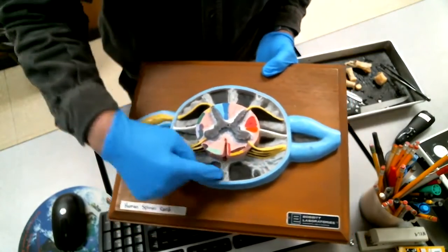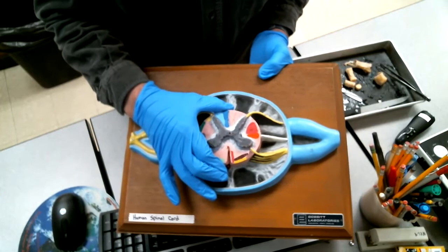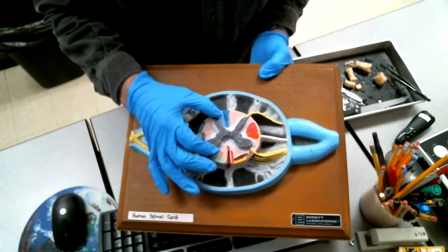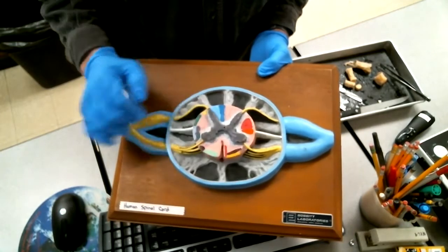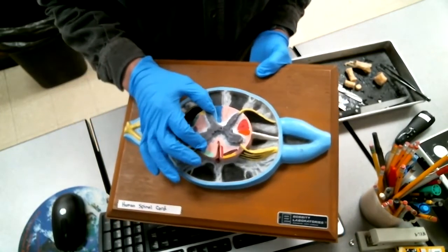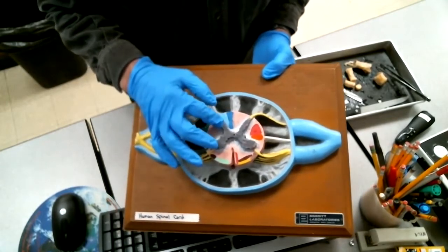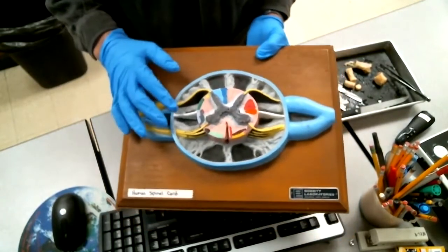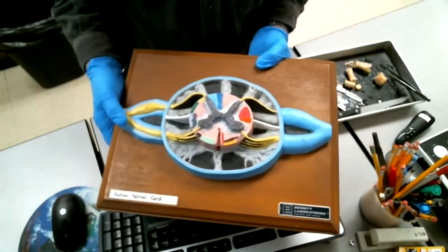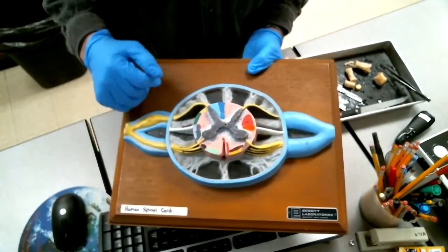This is the space around the spinal cord. This is actually the spinal cord right here. This is the gray matter, the gray commissure. There would be a central canal in there with cerebrospinal fluid in here. Here's where nerve cell bodies and reflexes occur. There are synapses in there. Out here, this is the white matter. This is axons and dendrites traveling up and down the spinal cord, carrying motor and sensory information.